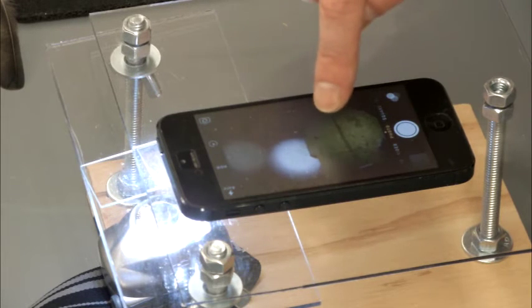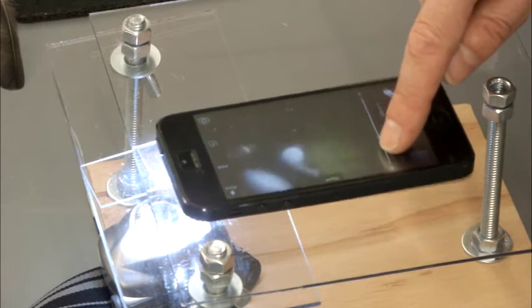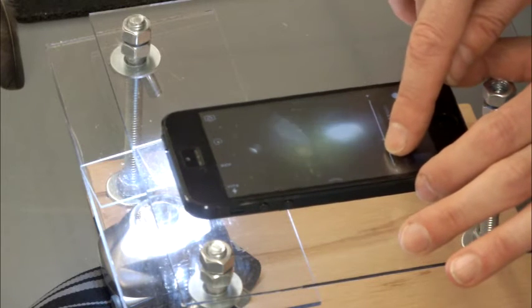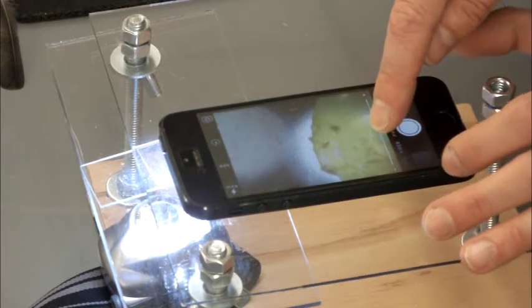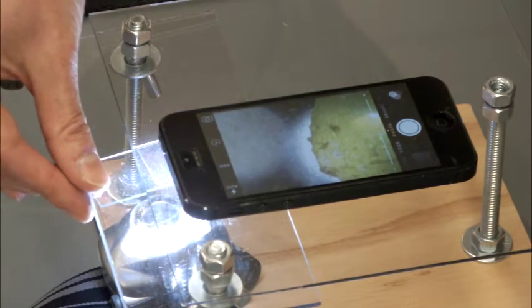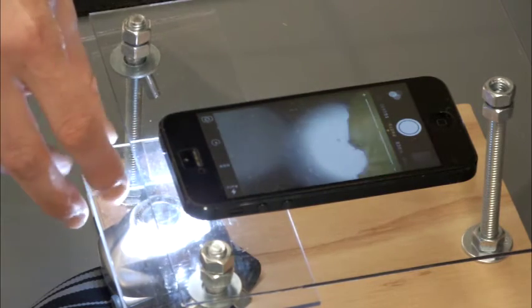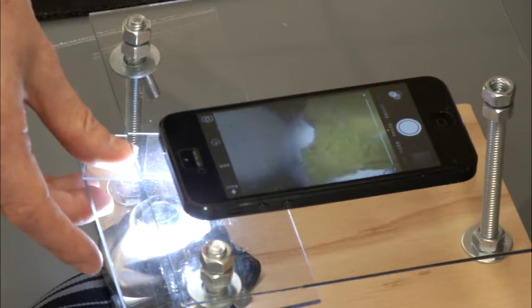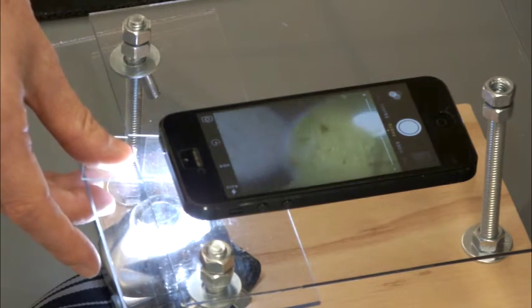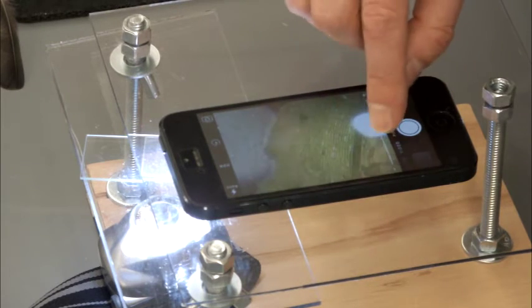So most cell phones, in addition to having just the camera on there, have a function where you can zoom in. So if we take our camera now, and we zoom in, we can get more detail for that leaf.